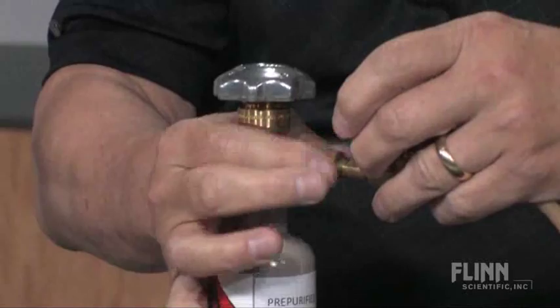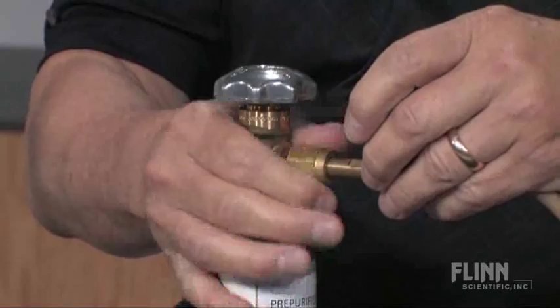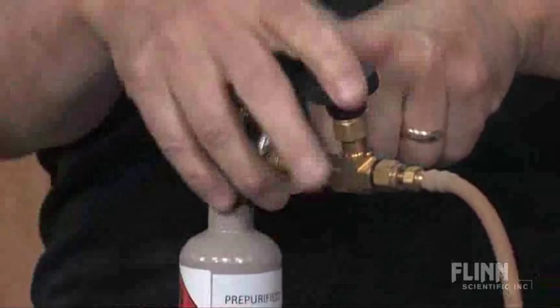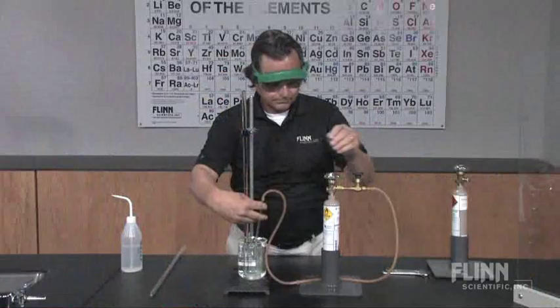Use gas cylinders or other sources to dispense small amounts of reacting gases into the tube. To introduce gases to the tube, first connect a regulator to the gas cylinder. Attach a hose connected to a J glass tubing.